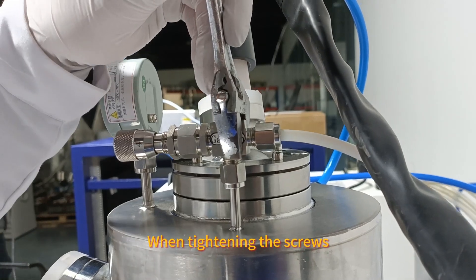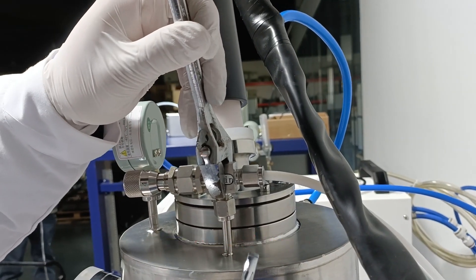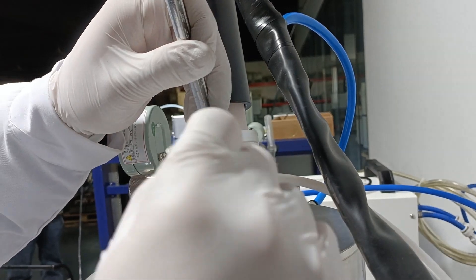When tightening the screws, need to find another wrench. Don't move this place. Then tighten.